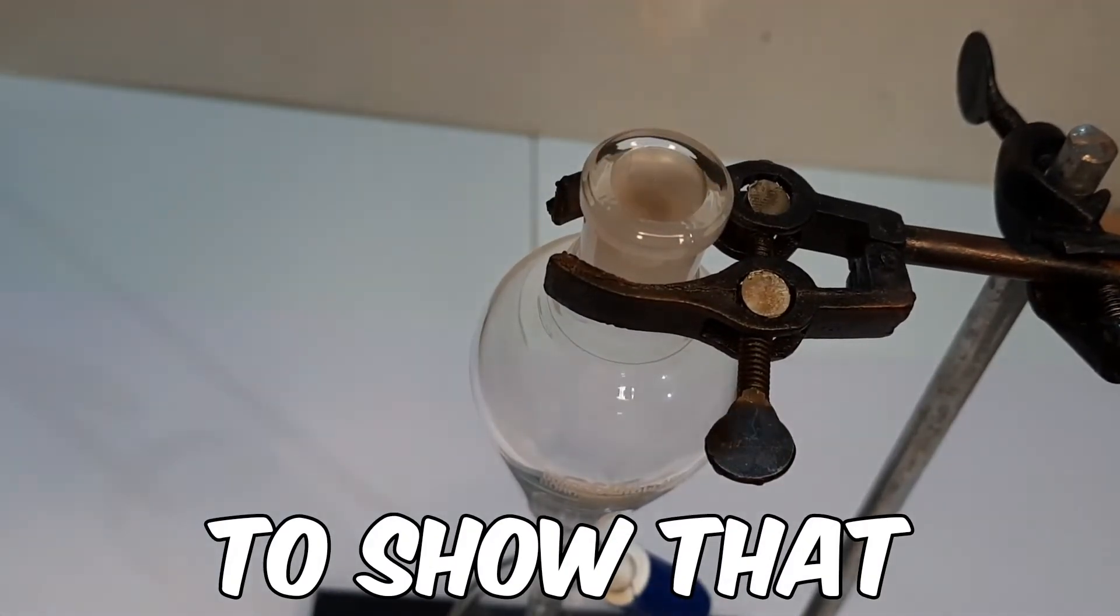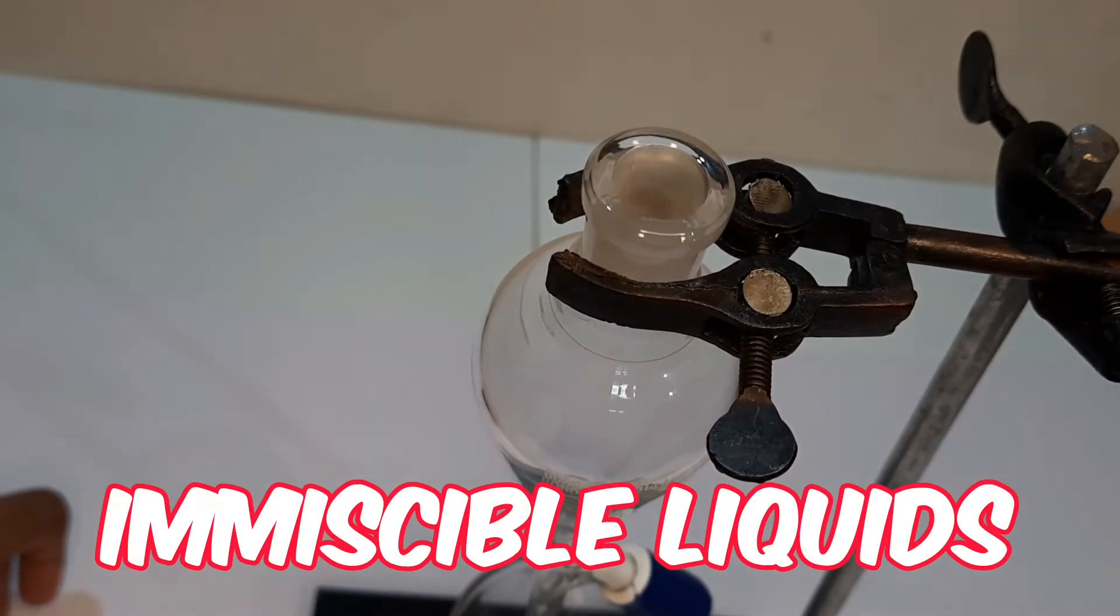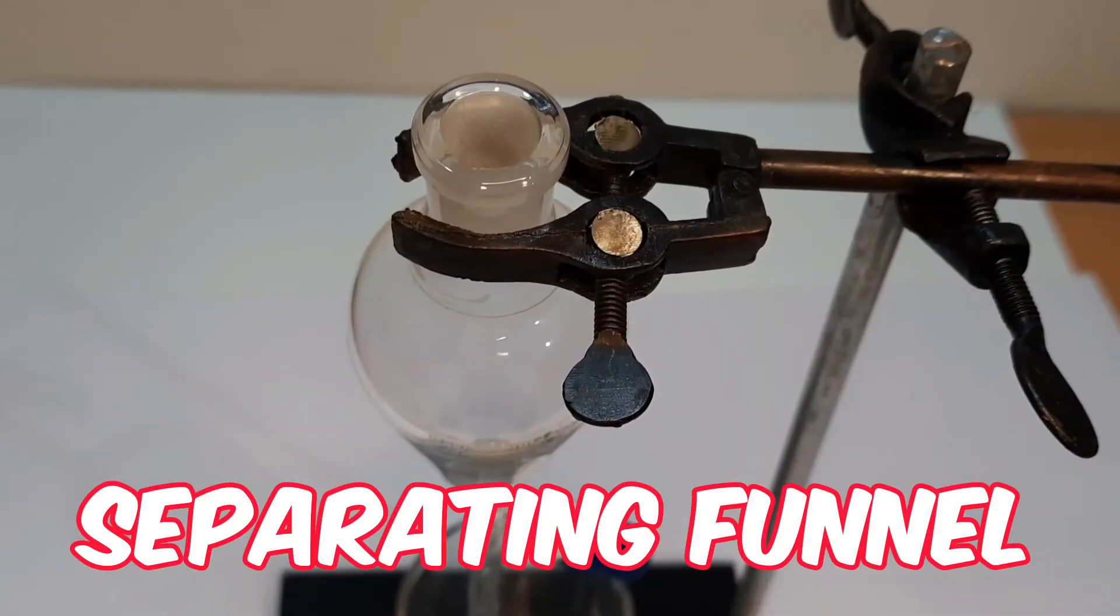Today we'll see an activity to show that a mixture of two immiscible liquids can be separated by using a separating funnel.